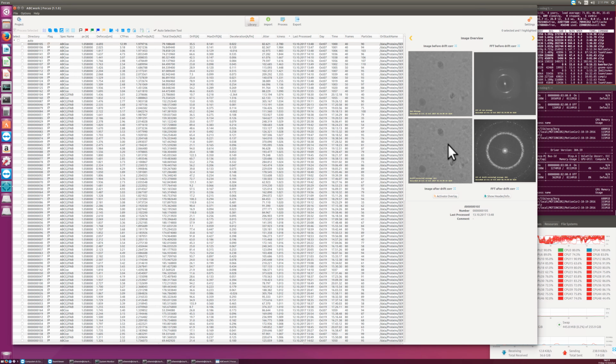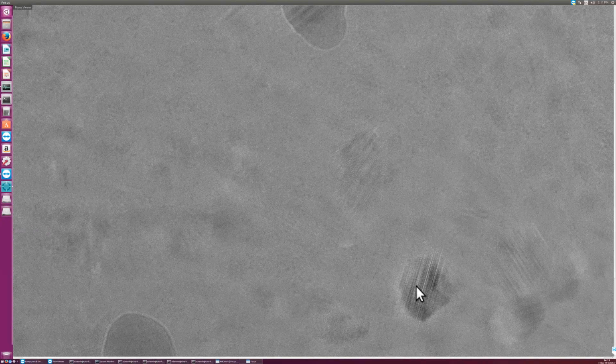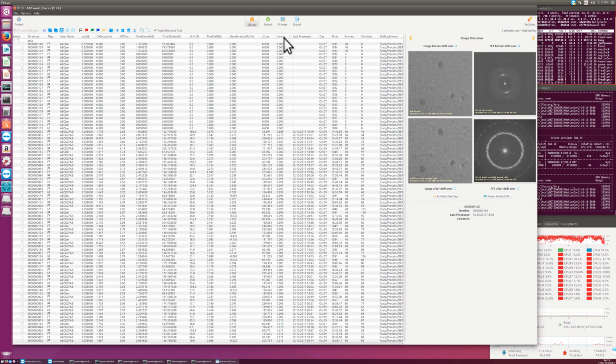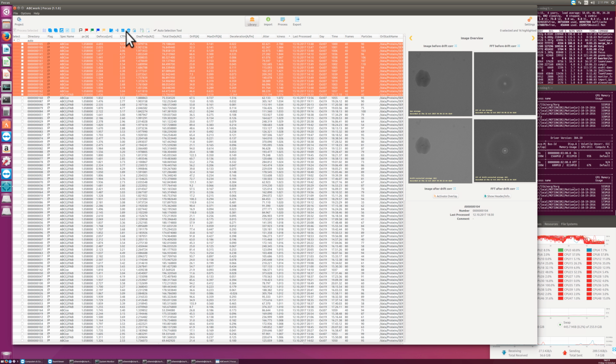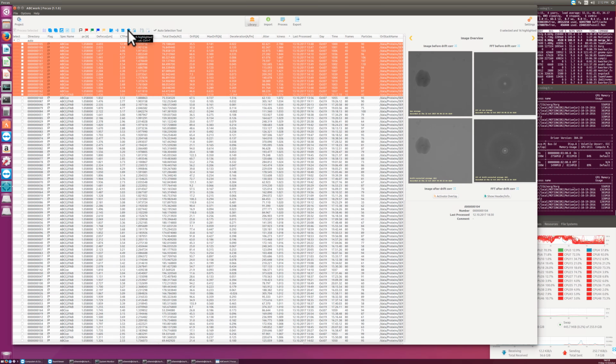So if you open this image instead by clicking onto the image, then we can see here the ice is really nicely visible all over the place. So this is a totally crystalline sample, and this ice is showing the reflections that we see in Fourier space in this ring. And such an image is difficult for image processing, so usually you would process all the images and then sort this long table by the iciness, and then I would say everything that has an iciness higher than 1.1 or so, all these here, I would move into the trash by clicking on the trash button here. And if I click here, all this will be moved into the trash.